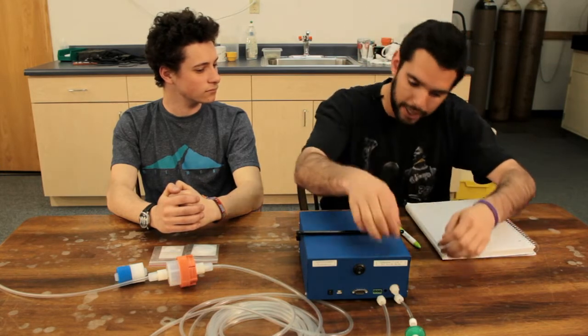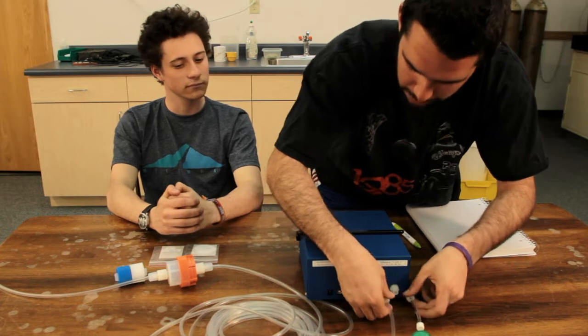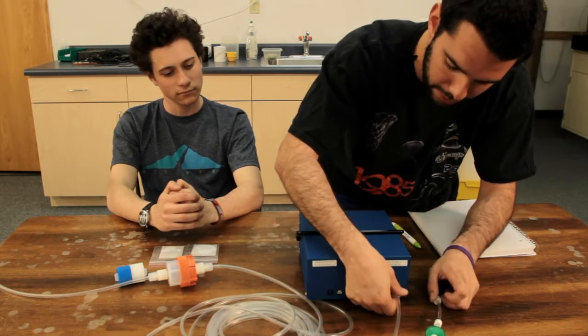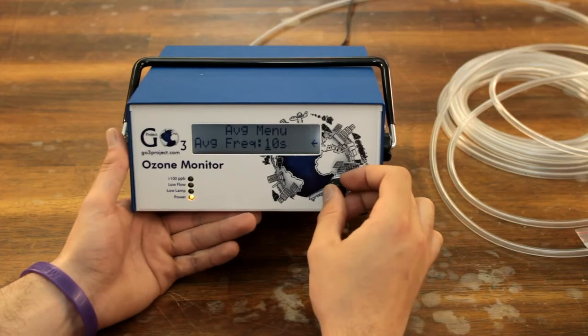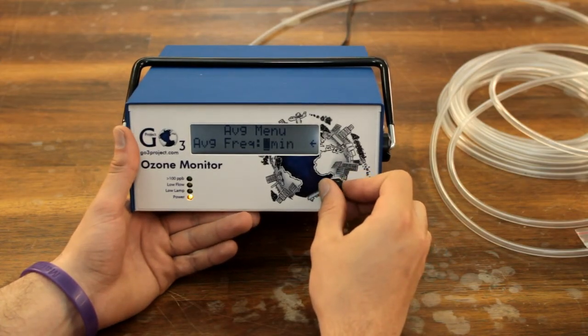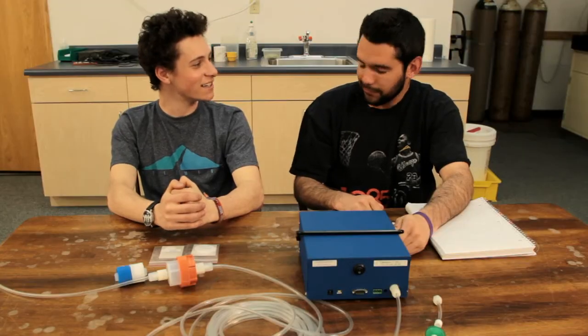After you've done that, you can go ahead and unattach the ozone scrubber, reattach your filter housing. You can go back in and you can change your upload time to 15 minutes again, and you can continue uploading. Wow, thanks so much, Cody. Anytime, man.